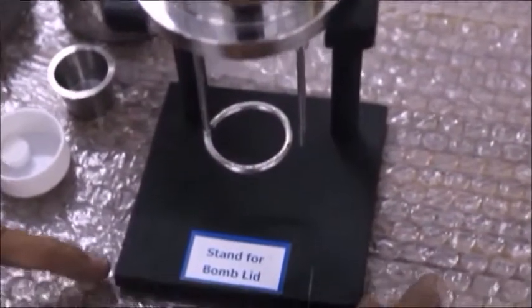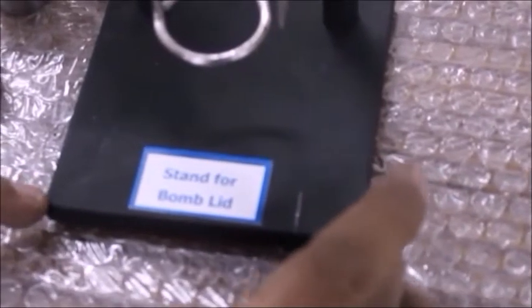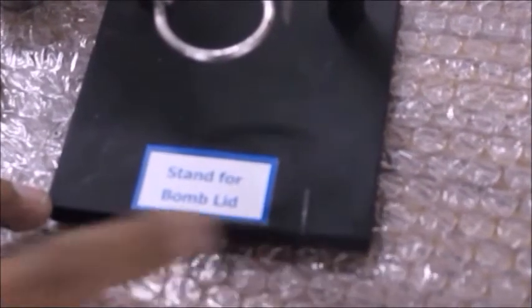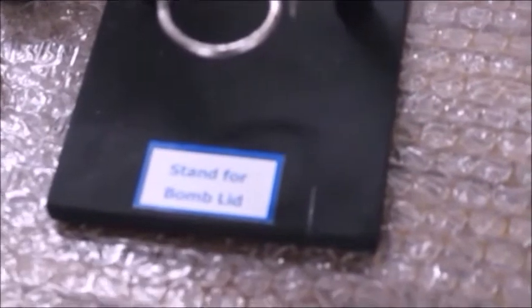We will now fully assemble the bomb. The bomb stand can be used to measure the length of the nichrome wire and the cotton thread. The width of the bomb stand is 10 cm until the marking is 8 cm.